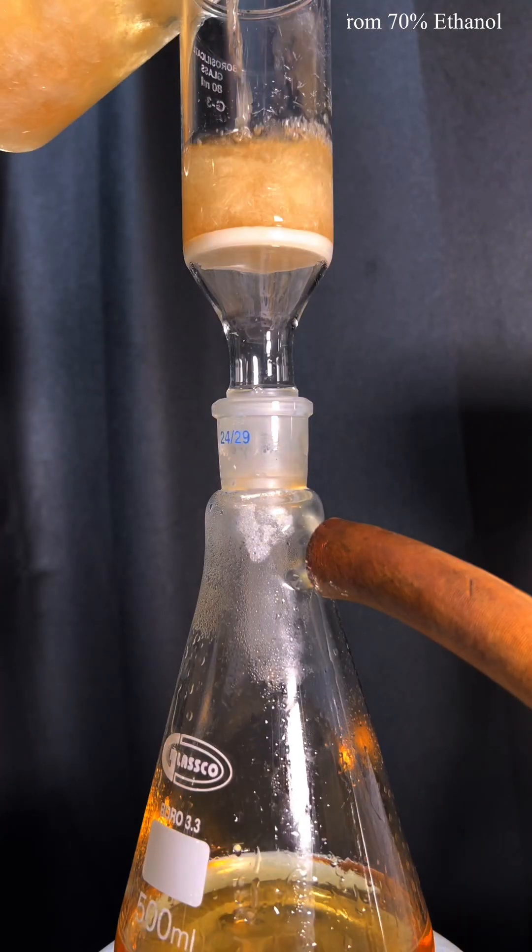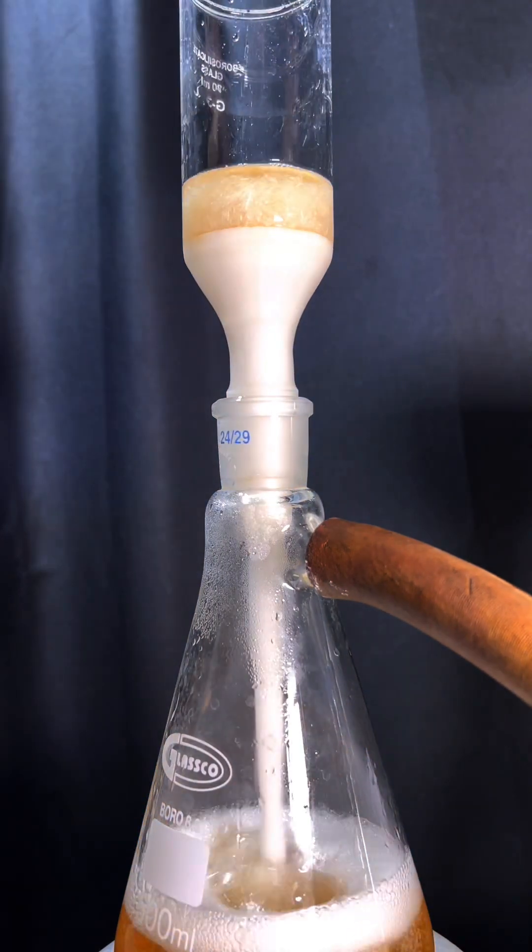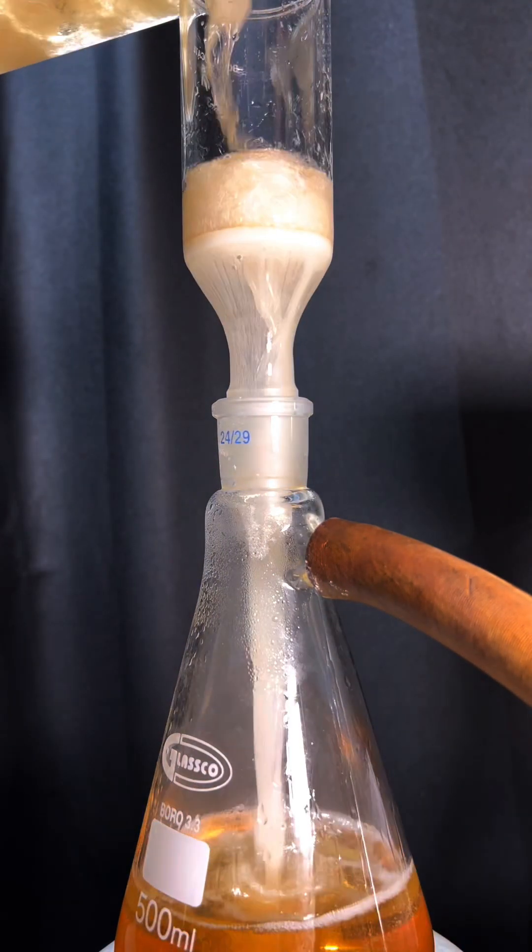Recrystallized crystals were then suction filtered and washed a couple of times with ice cold ethanol to get the final product.